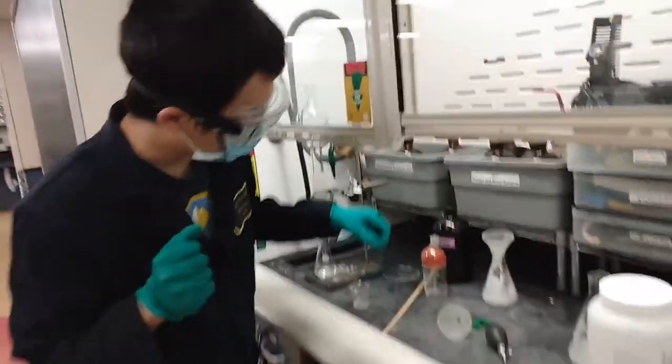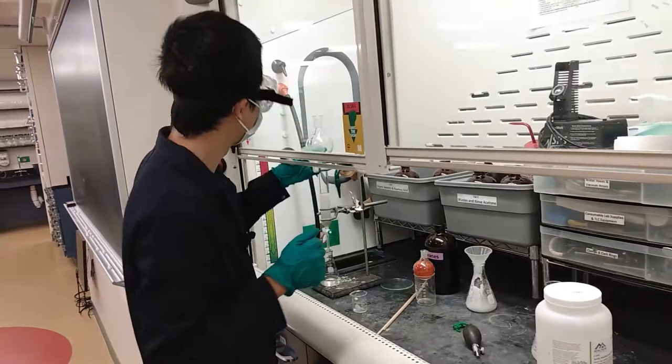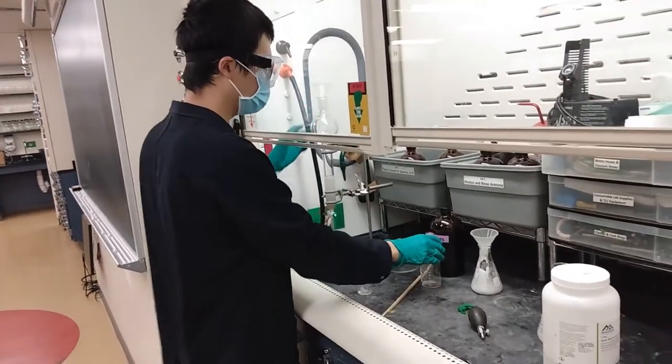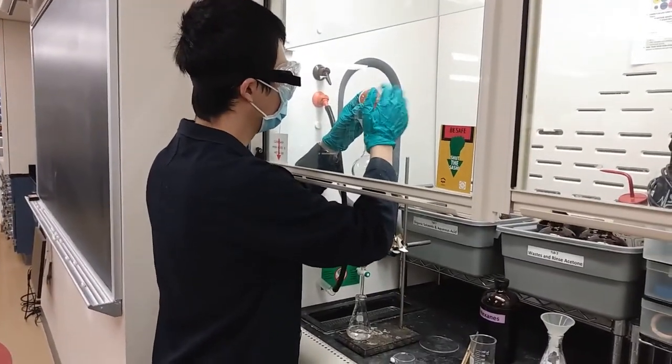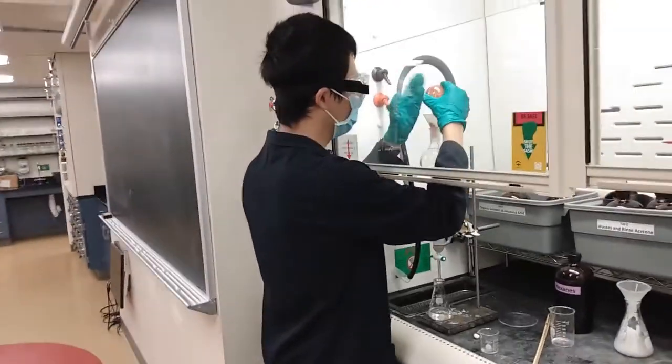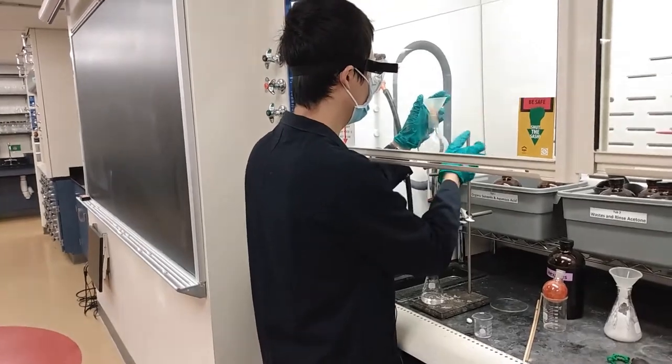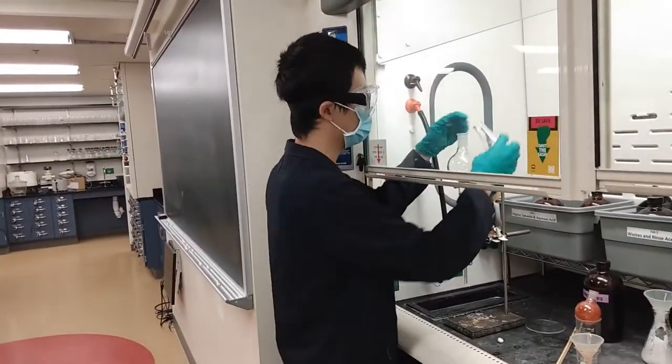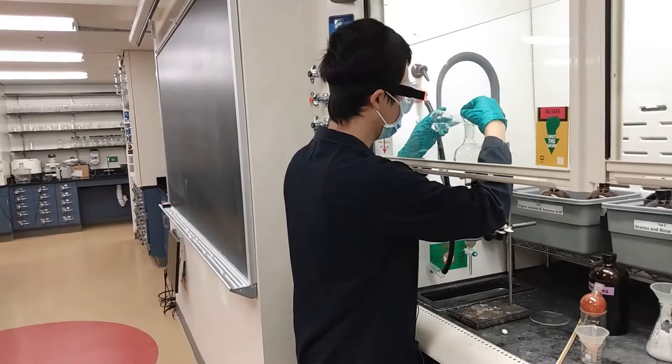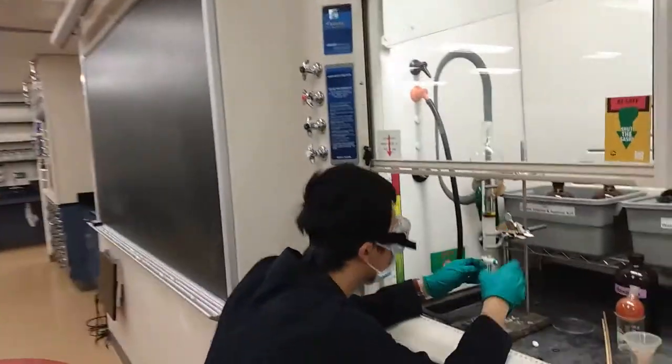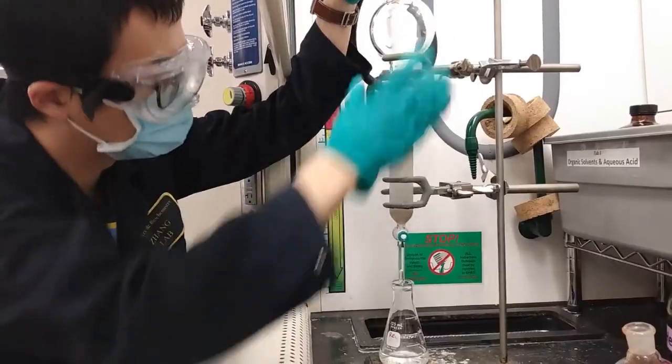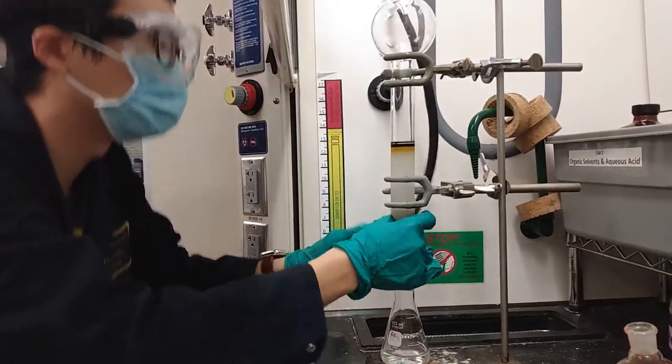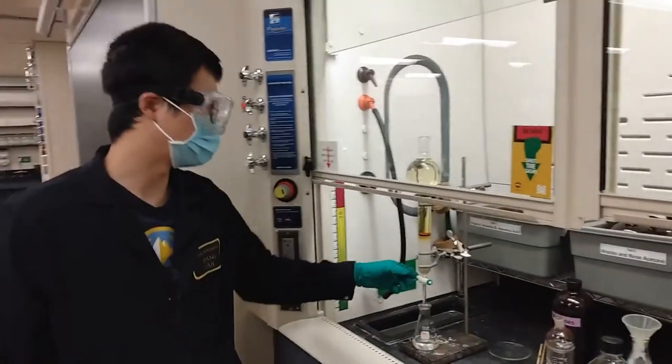Next we're going to load our sample to it. Sample loaded, still leave a little bit more solvent on the top. Next we can start eluting it.